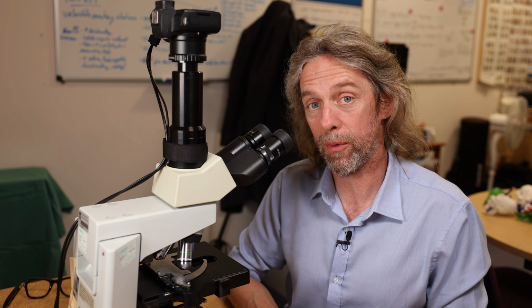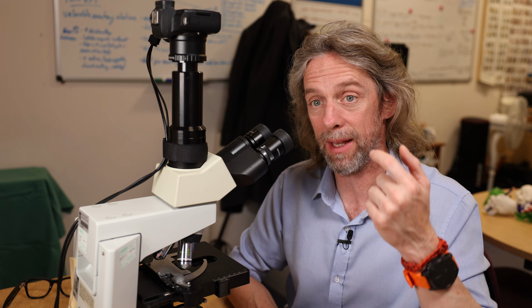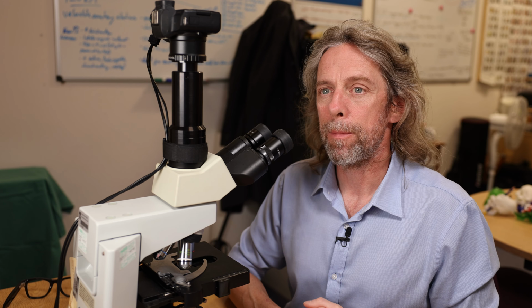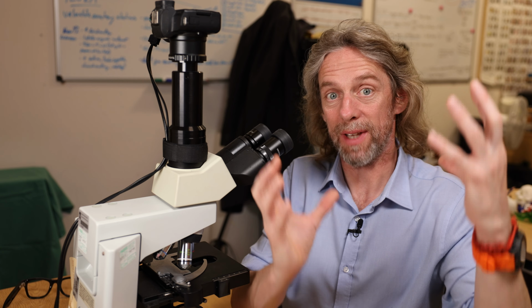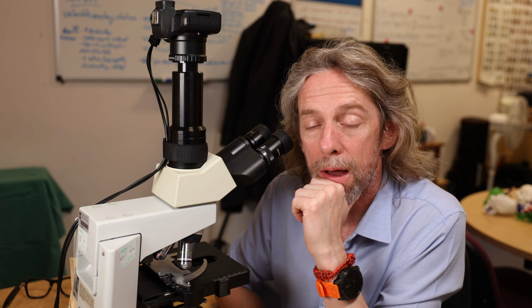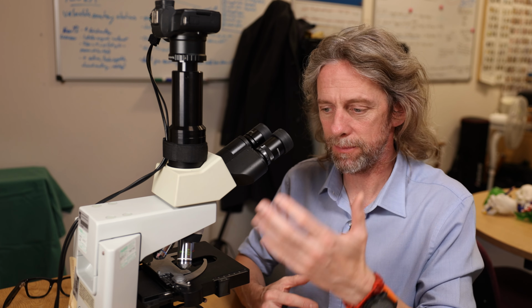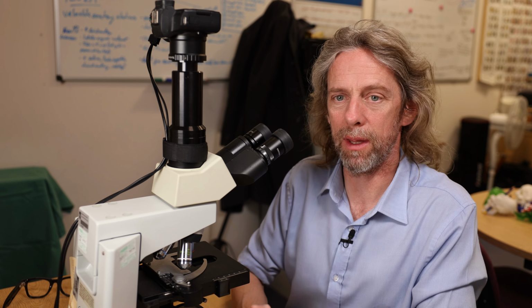And in the portal triad then we'll find those two inputs, branches of the hepatic artery, branches of the hepatic portal vein, and we'll find branches of the bile duct going out. That's it for the liver. In terms of the hepatic lobule, that's the hexagon, that's the arrangement of those inputs to the central vein output and flowing into the centre there. Whereas the other descriptions are just other descriptions of the same shapes. So the portal lobule and that sort of thing. But I think if you get the main features and you get the concept, you're 95% of the way there.